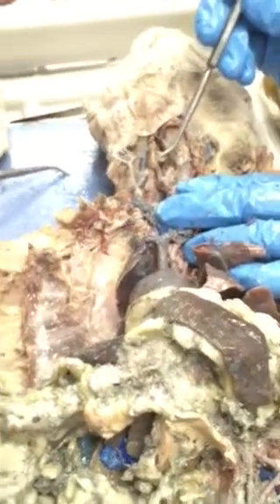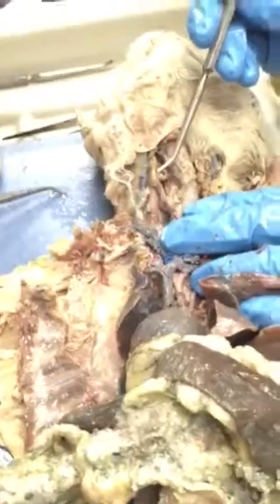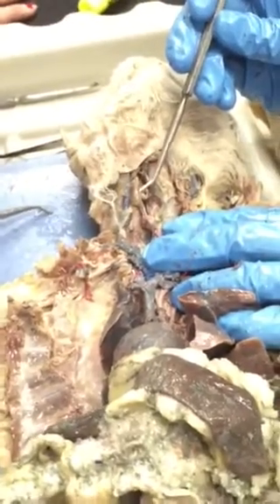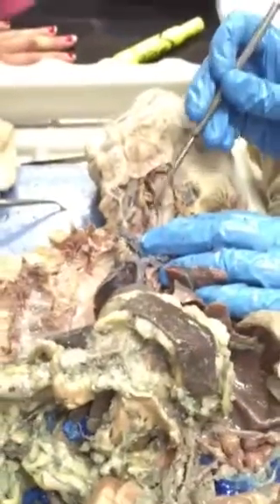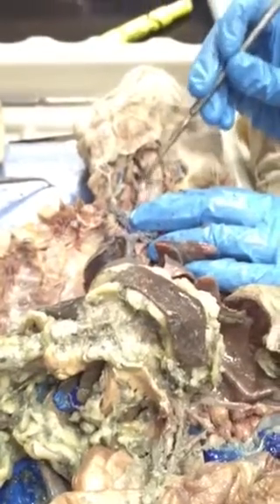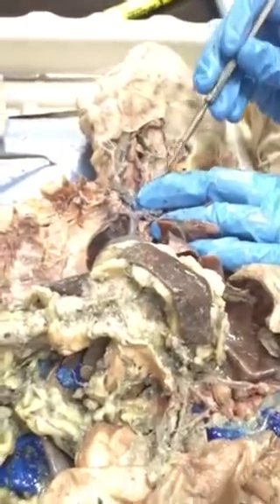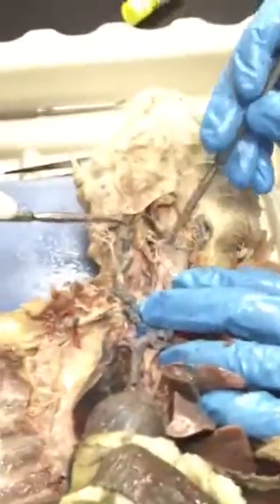What is on your list for starred items? External carotid artery, left and right external. Really? Yes. Sure it's not jugular? Positive. The jugular is on the vein list, but as far as arteries, it's the external carotid artery. Really? I must have made a mistake, because you really just need to know the common. That's fine. There is an internal and external, but I don't want to worry about it.